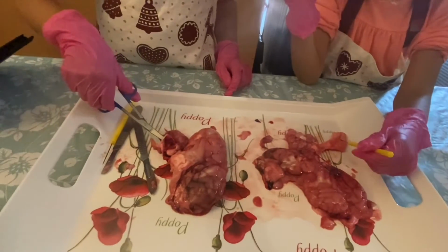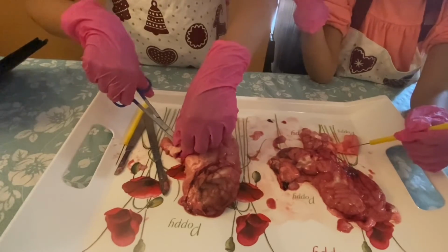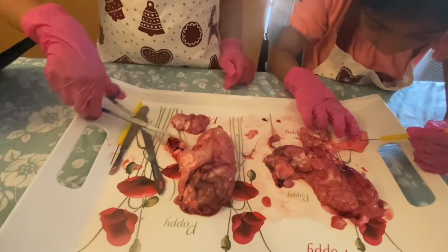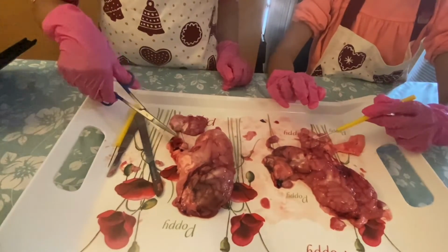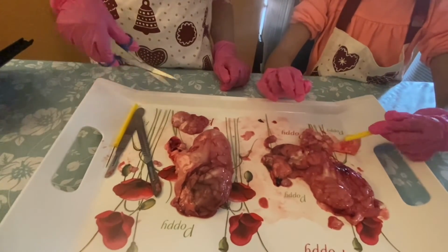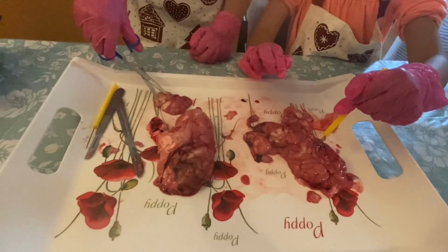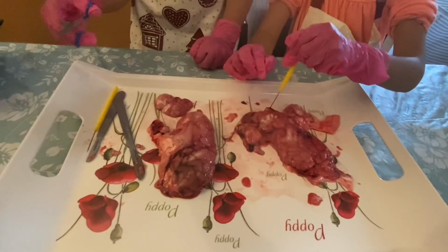I just want to gently cut that off. The cerebellum controls our movement, balance, and muscles. So it makes sure that we don't fall down. We can stand up straight. If you were a sheep, if you didn't have this part here that we just cut off, then you would just fall to the ground. You couldn't stand, you couldn't balance. Yes, exactly. Because sheep are not as intelligent as humans. So that would make it even less intelligent.